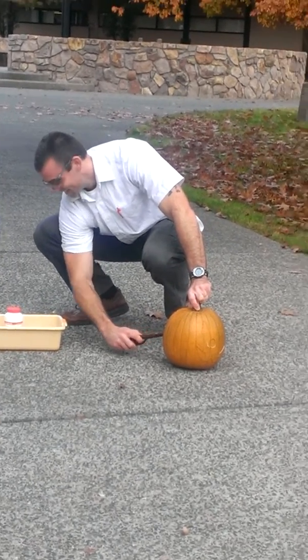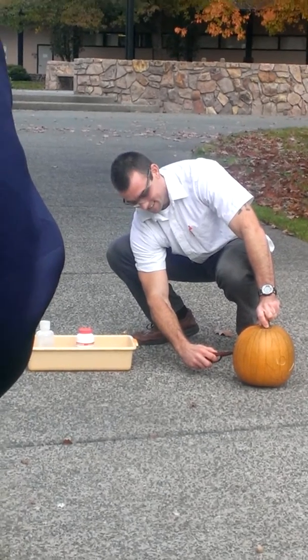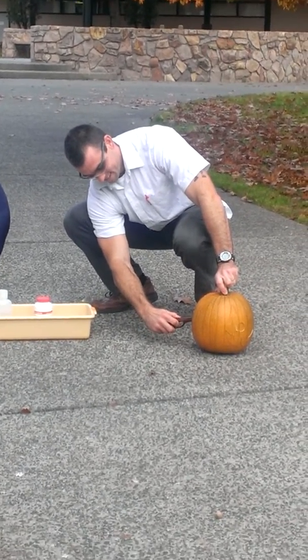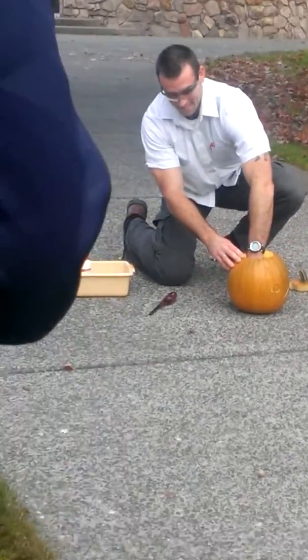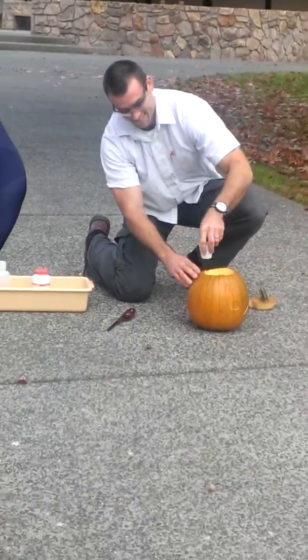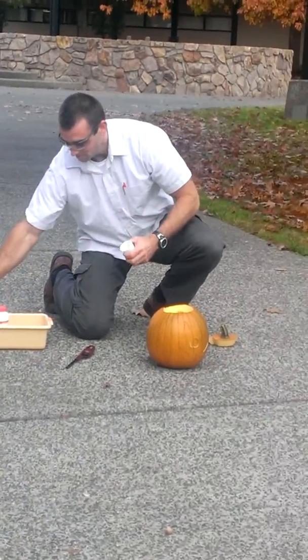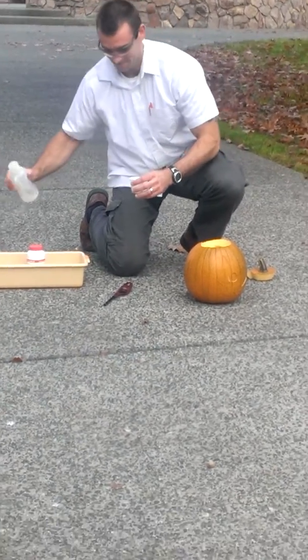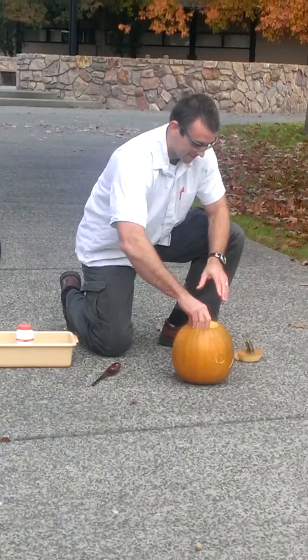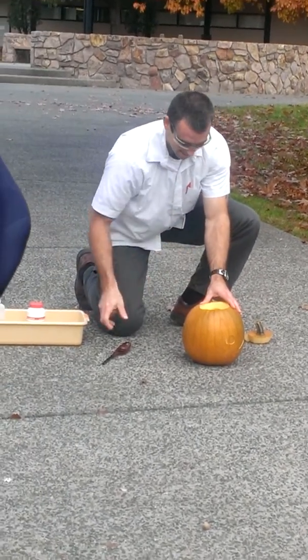Damn you! It's working. It's all been leaking out of that. Maybe we should. All right, we gotta do this again. I'm sorry. This is too embarrassing. How dare you? Chemistry is a difficult beast to tame.